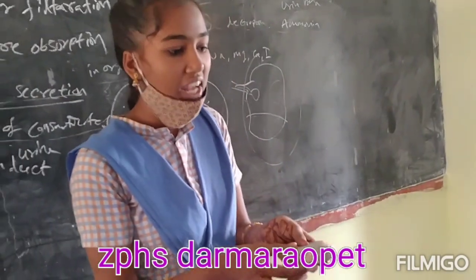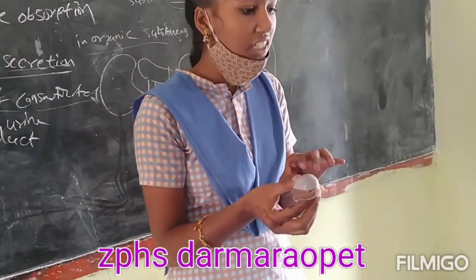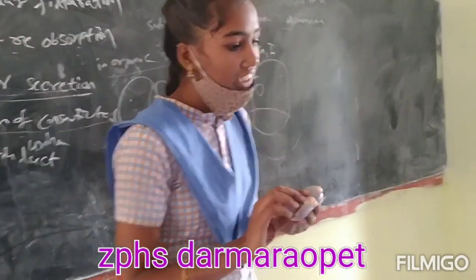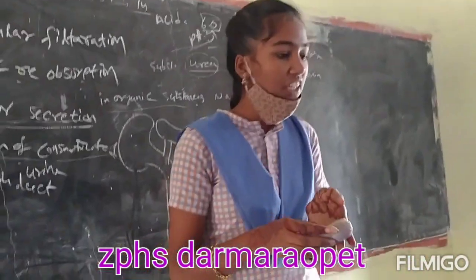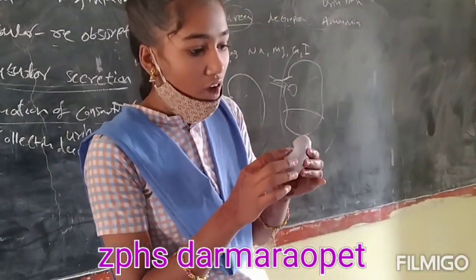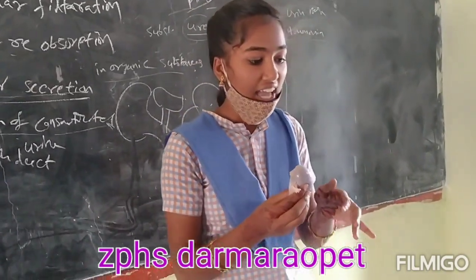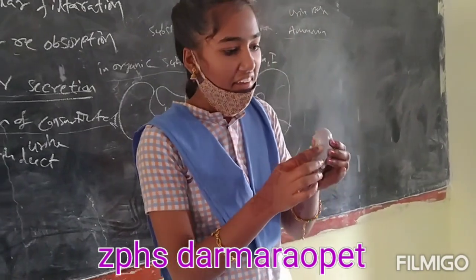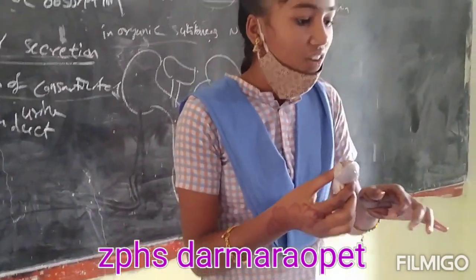The position of the right kidney is lower than the left kidney. The inner side of the kidney has tissue at the hilum, which is the entry of the renal artery, exit of the renal vein, and the ureter.